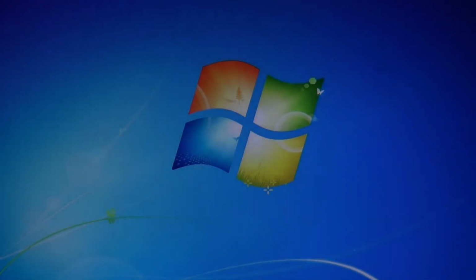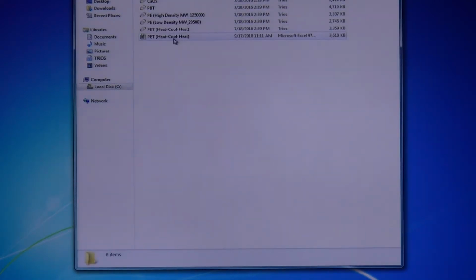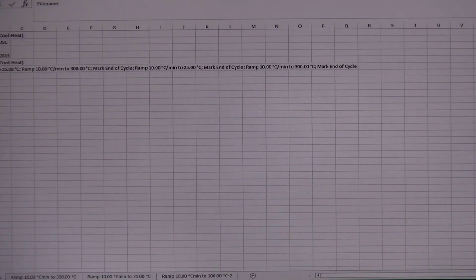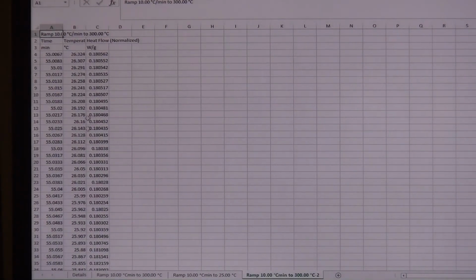And if I go into where it just saved it, you can see it saves it directly wherever your file is saved. So if this was saved in your folder, it'll pop up right in your folder. But essentially, when you open the spreadsheet, you will see that you'll have 3 default columns: time, temperature, and heat flow, normalized. And each one of the tabs is a different step in your experiment. The first page is actually details, which is all the things that you typed into that sample information, and it's all going to be here. Then the other page is going to be your first set of data. So this is your first heat, then your first cool, and then your second heat. They're all going to be split up into different pages that you can build and analyze separately.